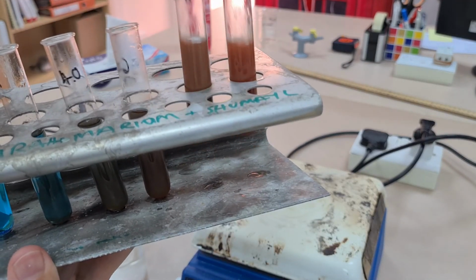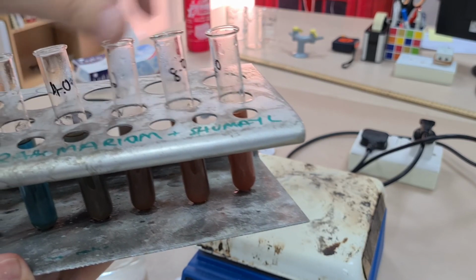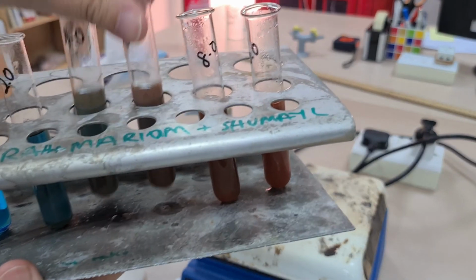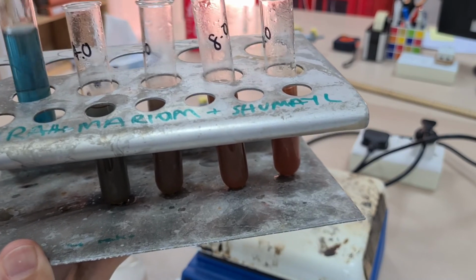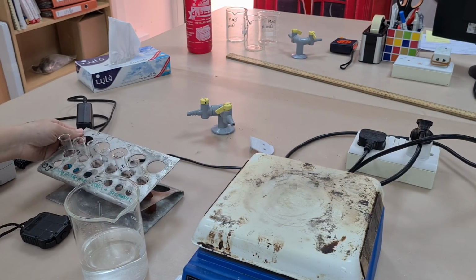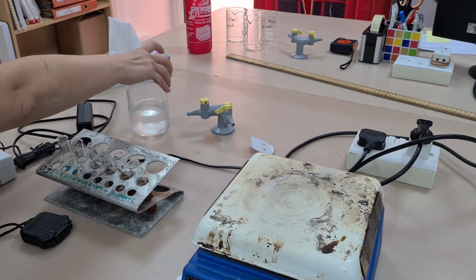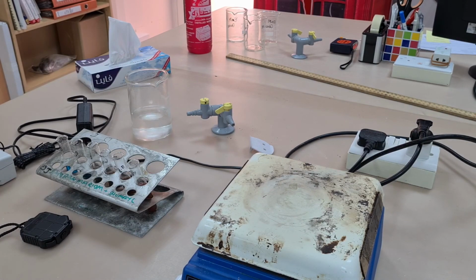And here we can see our gradation of colour, with the darker browner reds being for the more concentrated and the bluey greens being for the less concentrated monosaccharide. Remembering that the colour gives us some indication of the concentration of reducing sugar within.